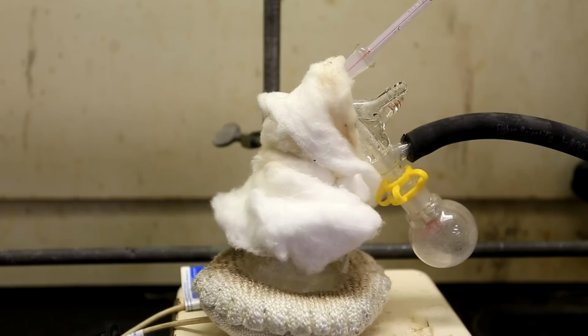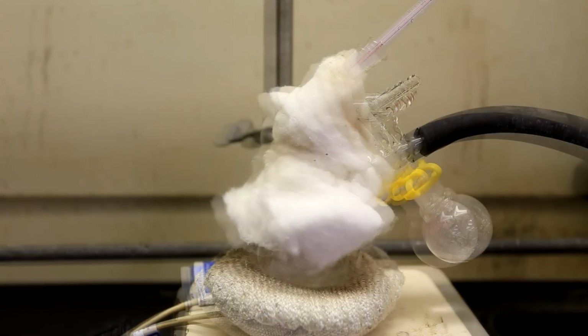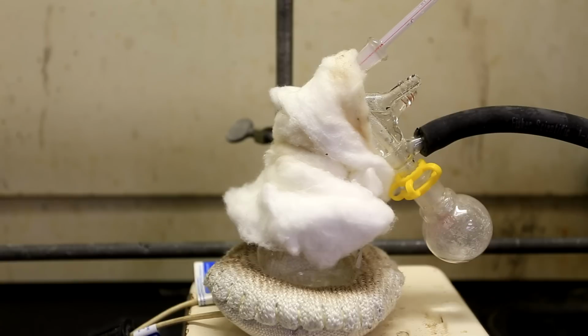The phenol in the collecting flask was then distilled again under vacuum at 40 millibars. The product that I collected was between 85 and 90 degrees Celsius. The portion between 30 degrees and 85 degrees contains a lot of water, so this was discarded for purity purposes. In theory, this part does not need to be done under vacuum, but you will need to do it at a much higher temperature if you don't.